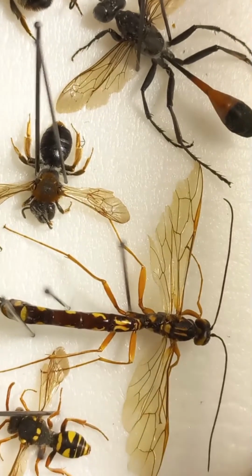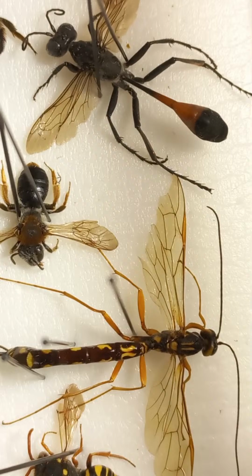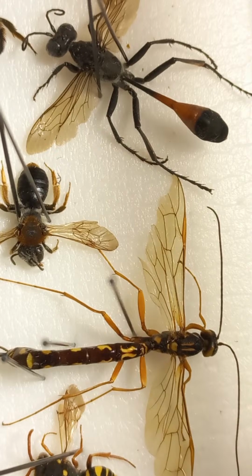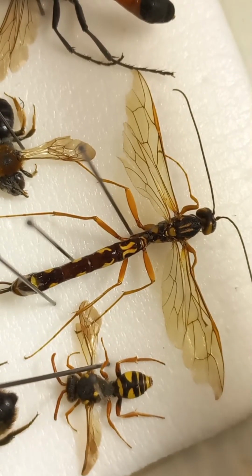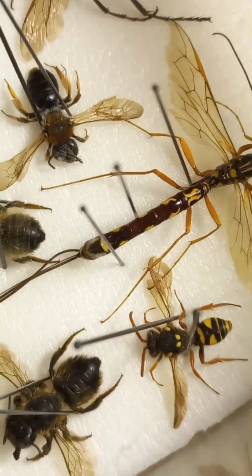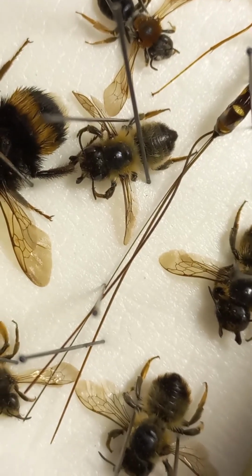And here one big parasitoid, which is quite big one. So this we observed Megascolia, and this is Megarhyssa. Megarhyssa, biggest one, with size of body about 2.5 centimeters, 25 millimeters, and very long ovipositor about 5 centimeters.